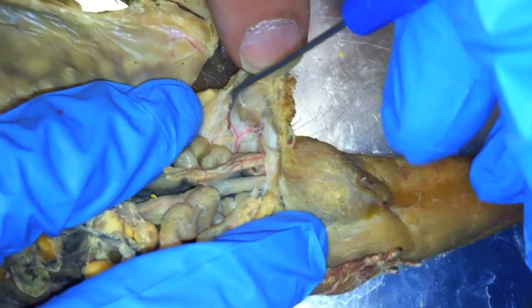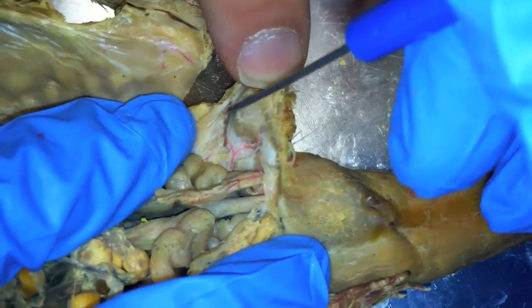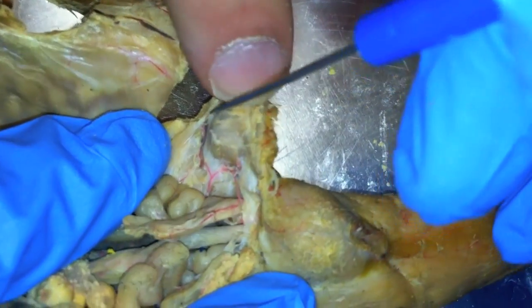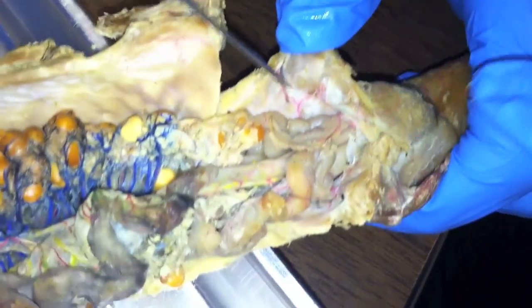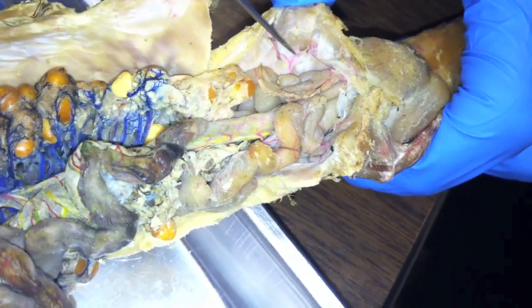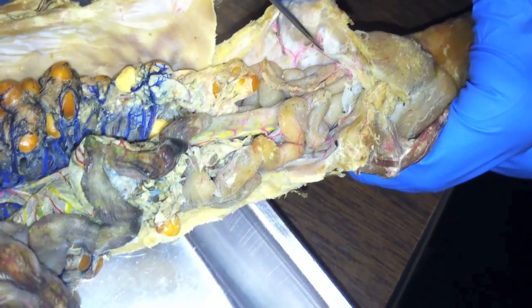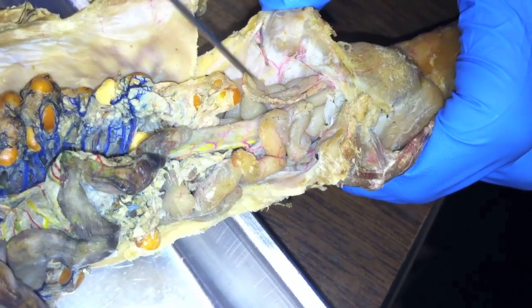We're pretty sure that this is the pelvic vein — the dark one. You can see where it branches right there, so the hypogastric is just where the branch is right there. It goes around into the epigastric and then iliac down.